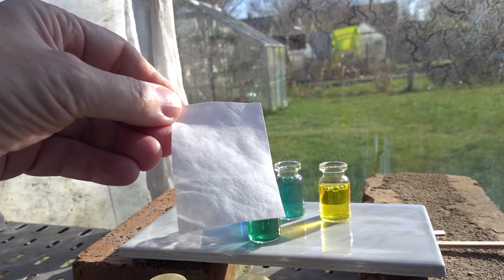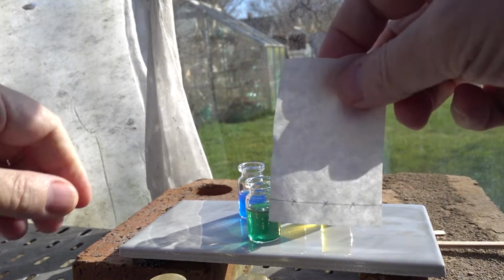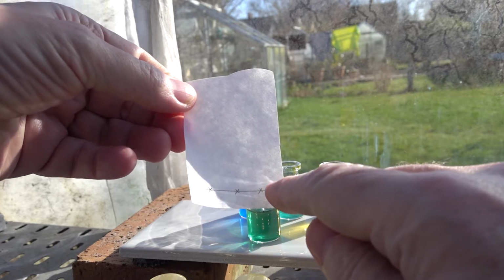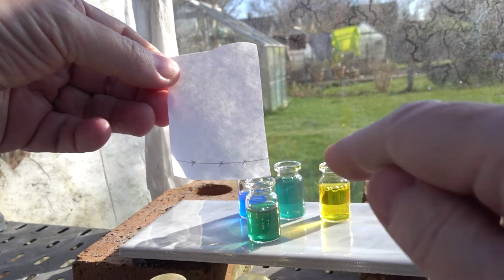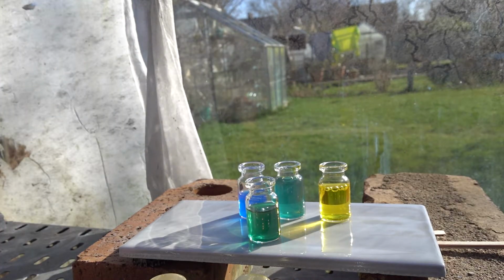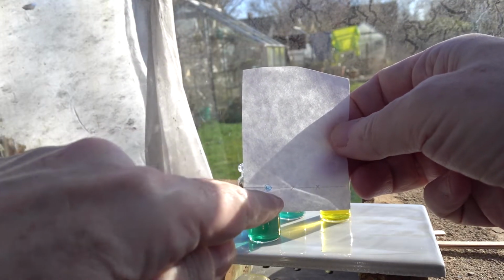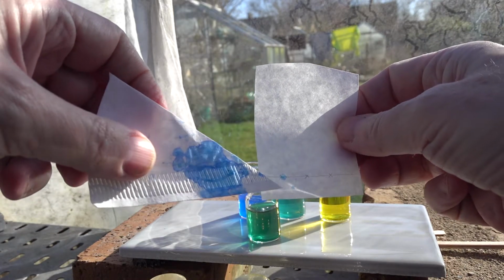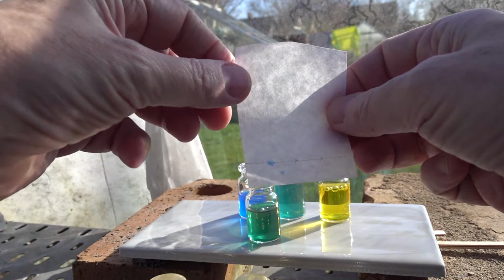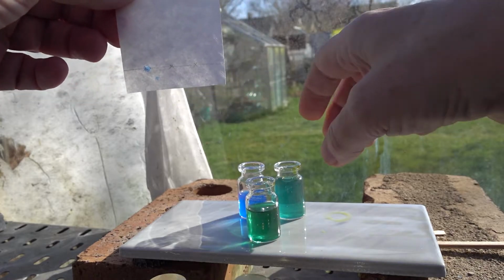filter paper that we've cut into a rectangle here, and standard technique to draw a pencil line 1 centimetre from the bottom of the paper, and we've got 3 samples, so we've placed 3 X's on the paper. Here's one that I prepared earlier with some of the blue colour, the spirulina extract there. You can see that it stains the paper rather well. Bit of a mistake there. Well, let's have a look at the spotting process at home in the greenhouse.